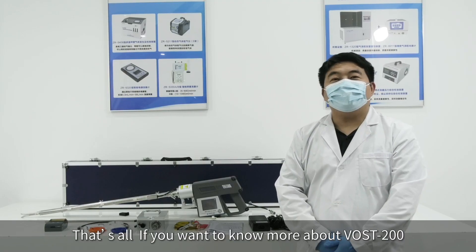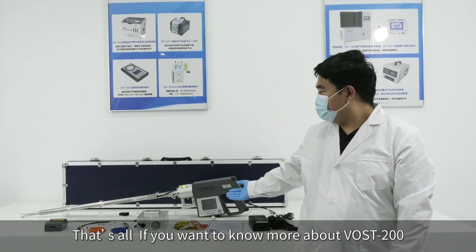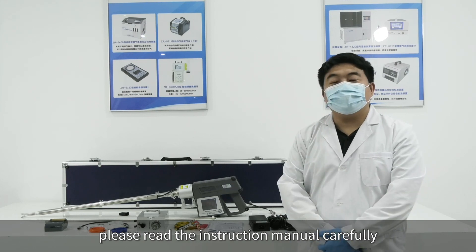That's all. If you want to know more about the VOST-200, please read the instruction manual carefully.